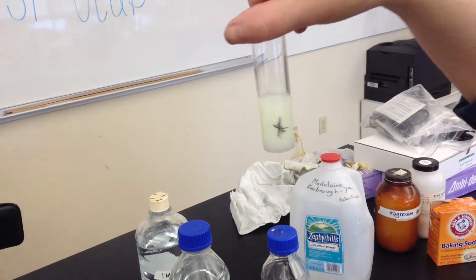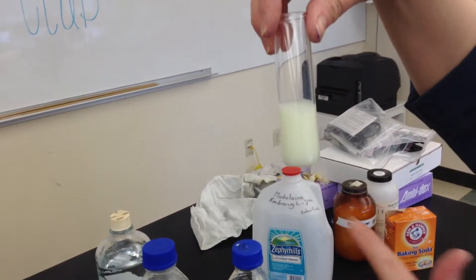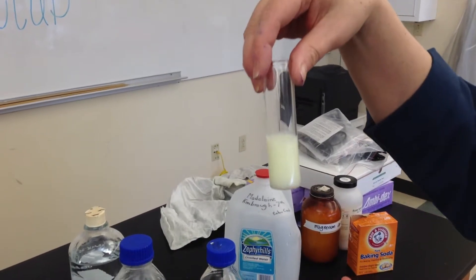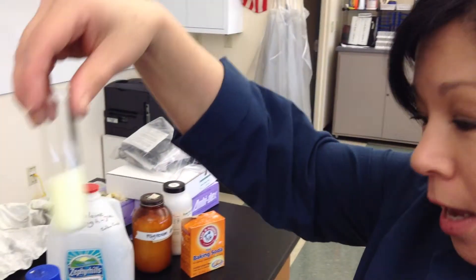See, it's visible on the back, but you can't see it through the solution, so that would be a way to monitor a rate that makes a cloudy solution.